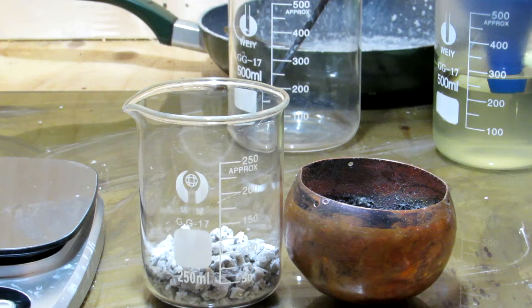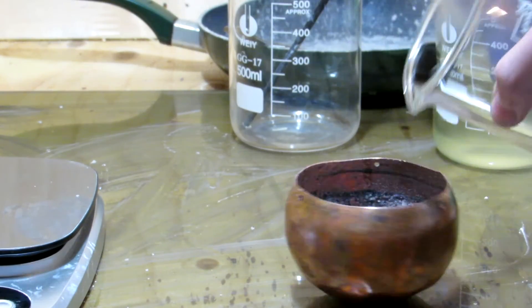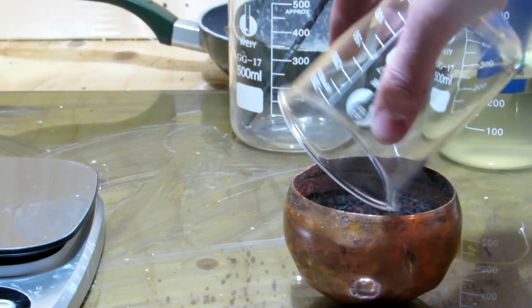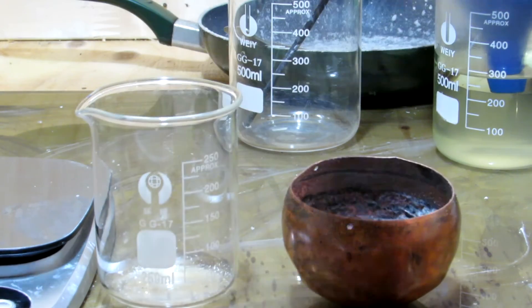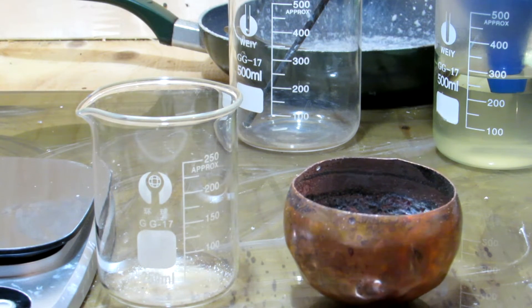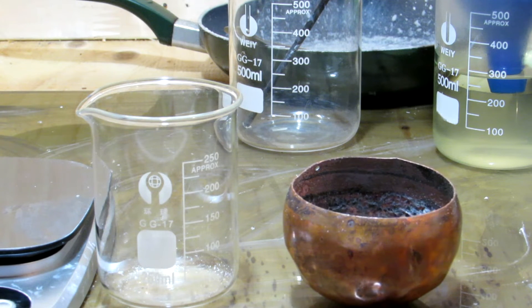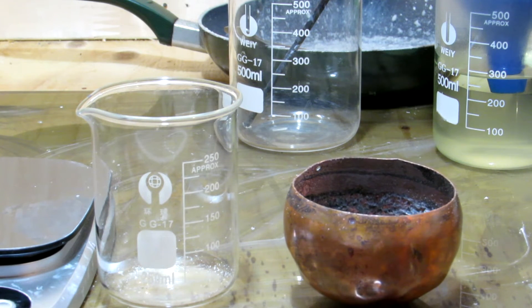So, we'll be needing about 52 grams of our sodium dihydrogen phosphate here, which we actually produced in a previous video, and we're going to be starting by adding it simply to a metal dish. I have a copper dish here, and this is just nice because it's nice and flexible, which makes it easy to get the product out at the end, but any sort of steel or flexible, thin metal dish will work for this.